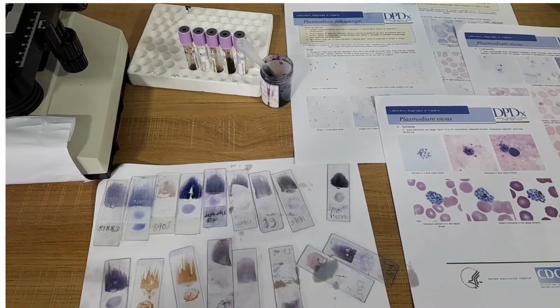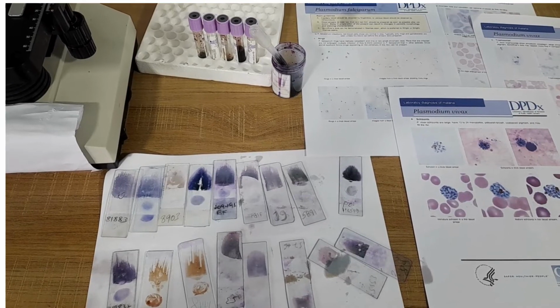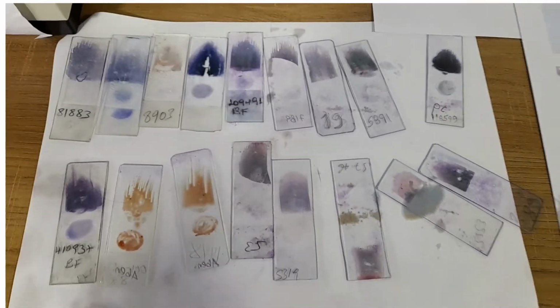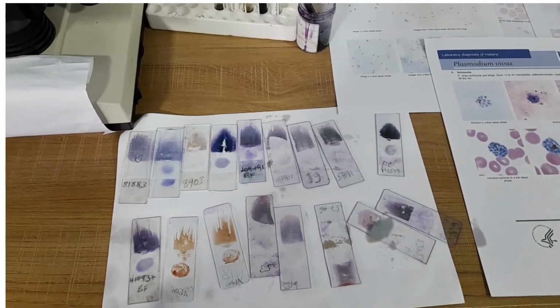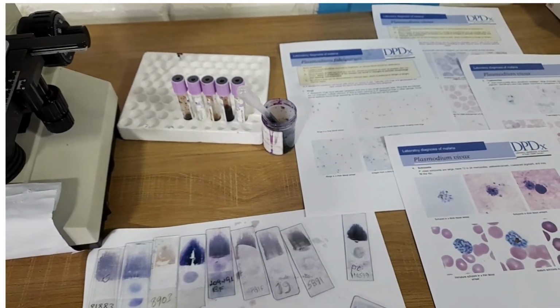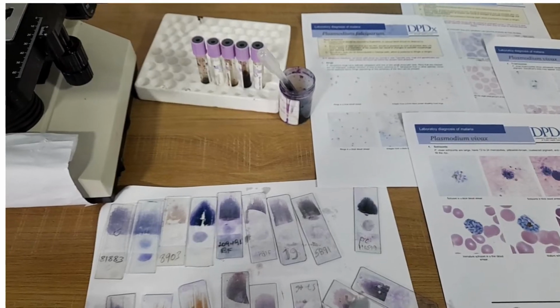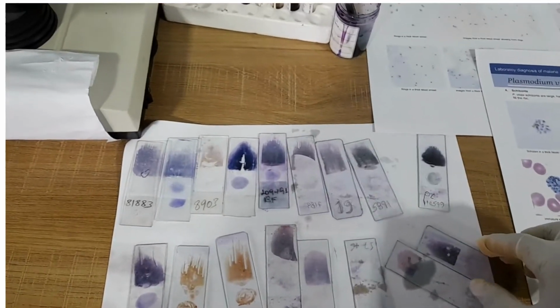So, for microscopic diagnosis of malaria, we use different kinds of materials. The first one is the microscope, obviously, and the second one is microscopic slides like this, prepared with a thick and thin blood film, and we will need Giemsa stain. We will prepare it in a 1 to 10 ratio, which is 9 parts of water, distilled water actually, and 1 part of Giemsa stock solution. Having this, we will prepare a blood film on the slide.